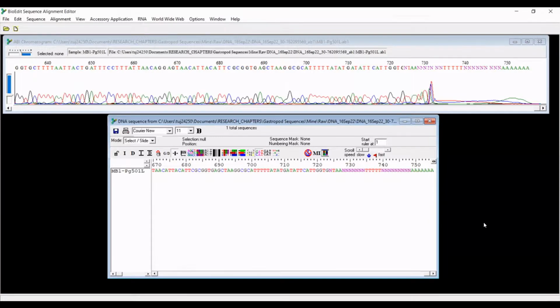So the reason why I start at the end of the sequence is because as you go through and verify the base calls, it's best to not mess with the base position. If you start to trim your sequence from the beginning, none of your base positions will ever match. It just makes it a lot harder. There's no reason to complicate things any more than they already are. So I always recommend starting from the back and working forward.